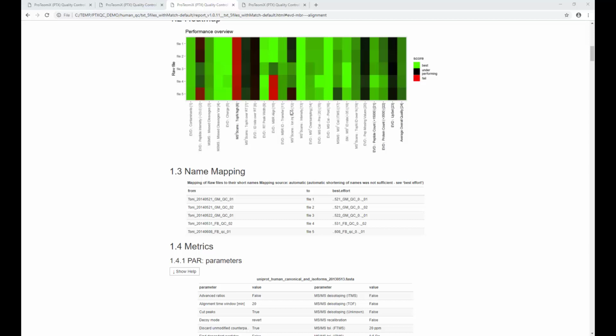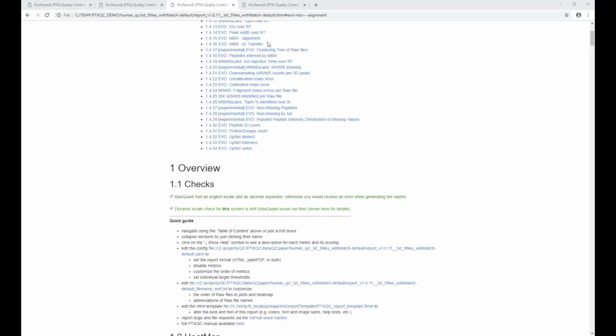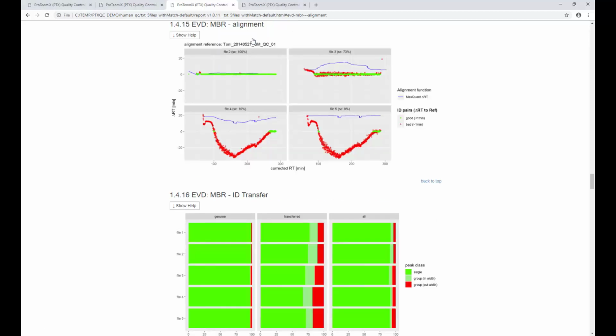But something is wrong here in the match between runs metric. So let's quickly look at this and see what's wrong there. Where do we have it? Here, match between runs. So what this basically tells us: MaxQuant was instructed, in case it could quantify a peptide intensity signal in MS1 but could not identify it because it was missing a corresponding MS2 spectrum, or it couldn't identify the spectrum after false discovery rate filtering, to act. So what MaxQuant can do, based on an accurate mass and time tag basically, is transfer a peptide spectrum match from one raw file to the next.